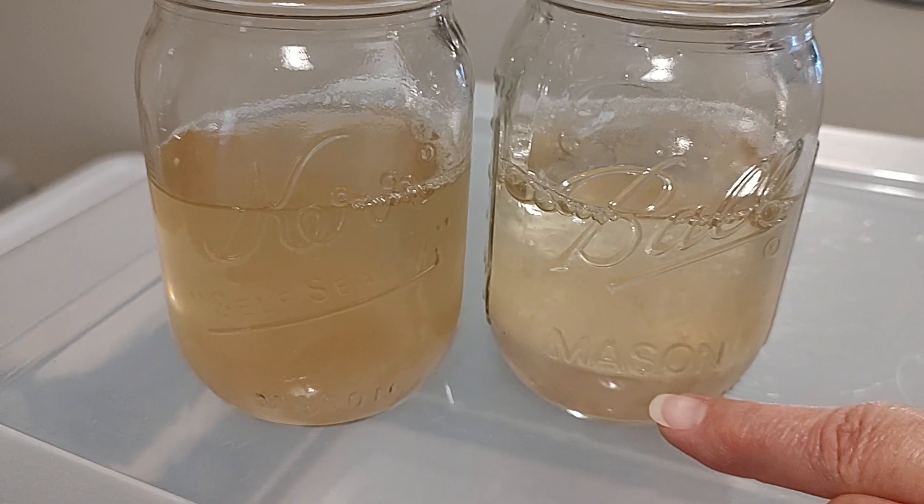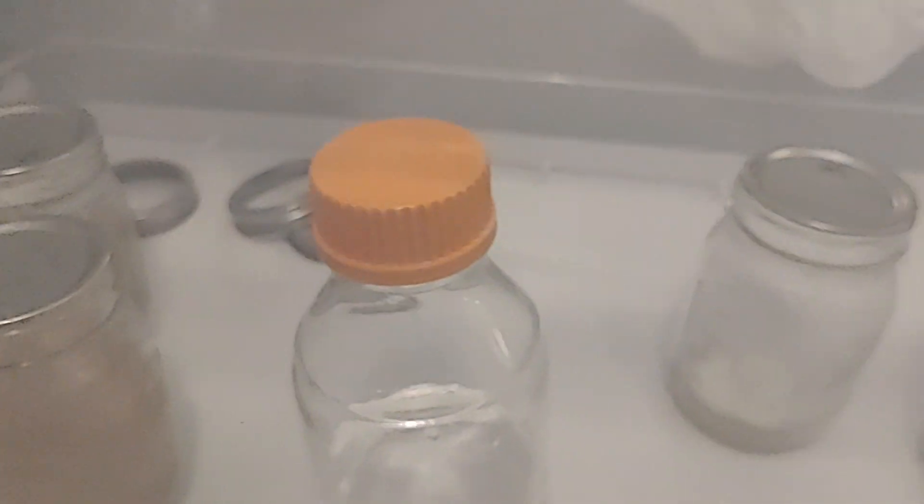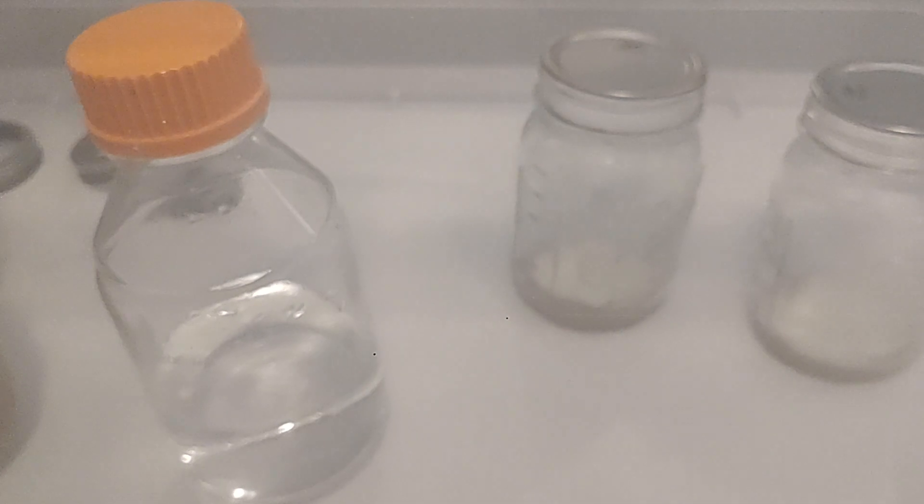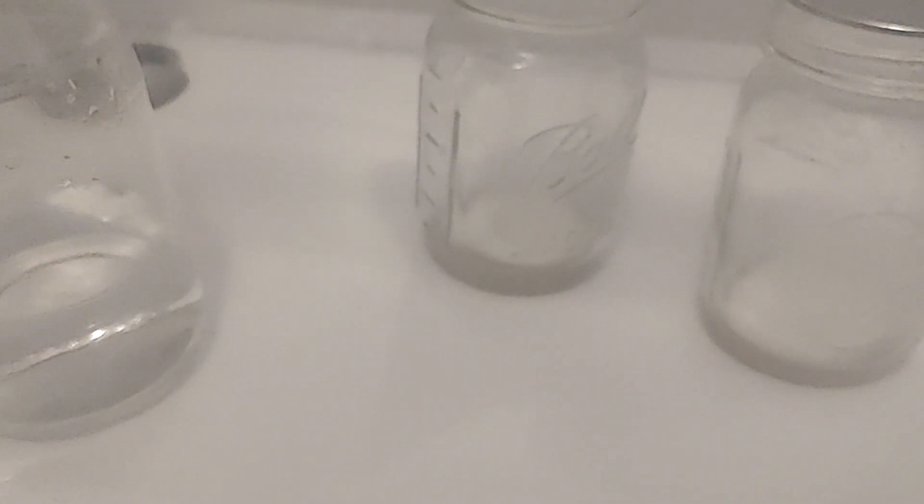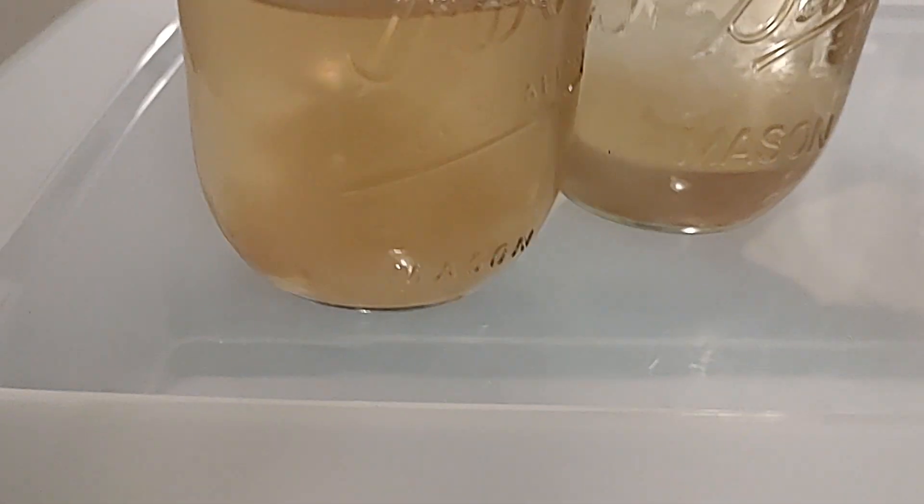I'm going to have a video for you on this. I will show you what's happening in here, and then I'm going to pour the water in for you so you can see what's happening when we create the slurry. The slurry is just another liquid culture.